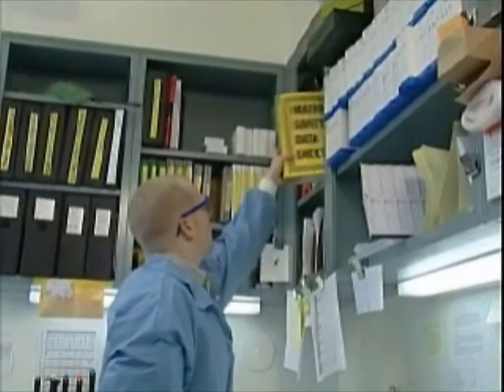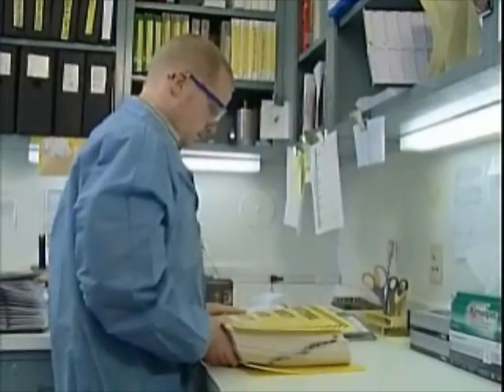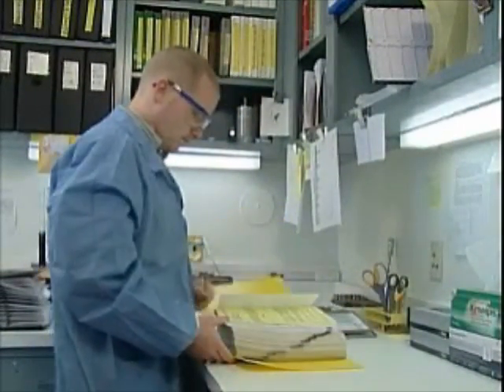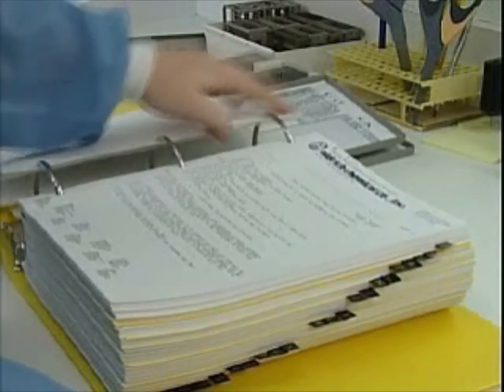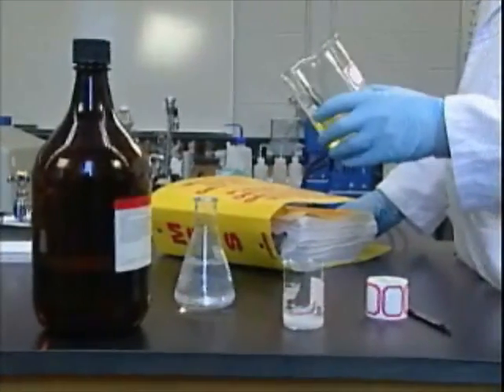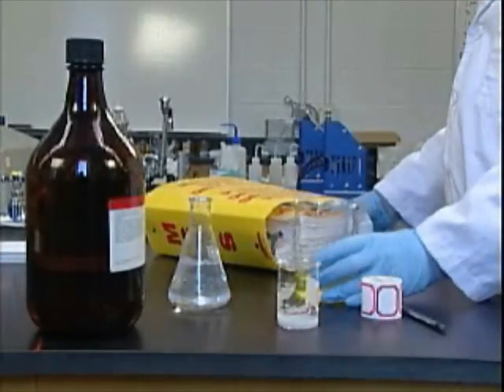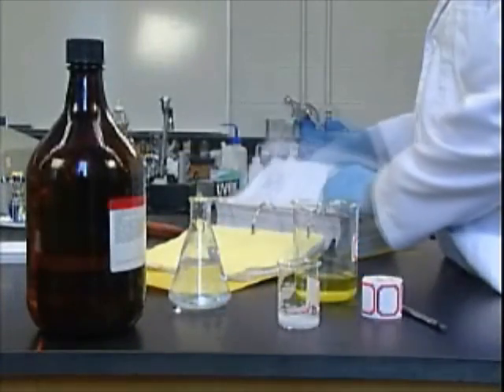To effectively shield ourselves from contamination, we need to first know about the materials we're working with. So you need to read product labels and material safety data sheets before starting to use a substance. These and other references describe the potential hazards presented by the material, and they tell us how to protect ourselves from contamination.